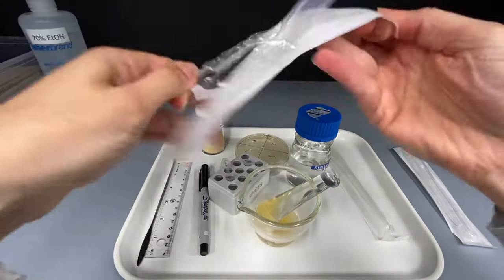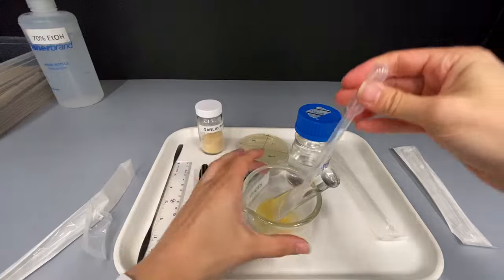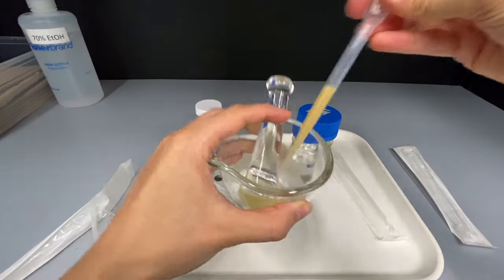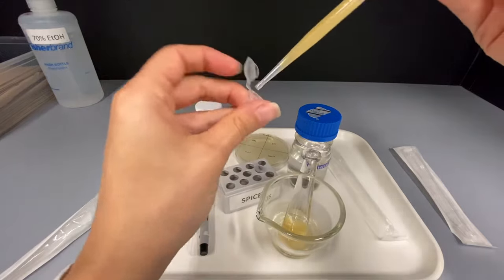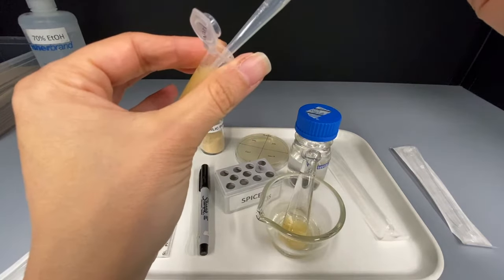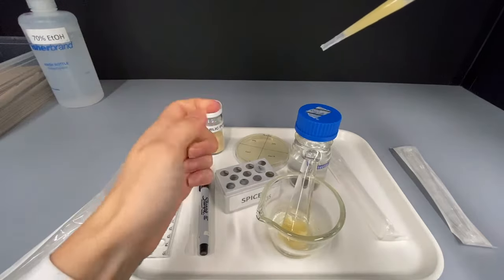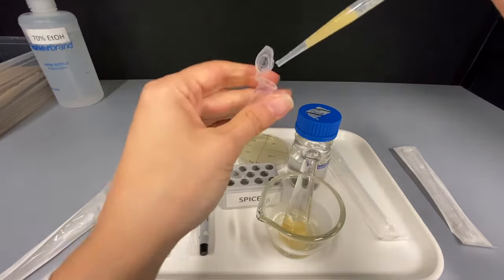Using a clean plastic pipette, transfer 1.5 ml of spice suspension to the tube labelled Gar-1. Take 0.5 ml of spice suspension from the Gar-1 tube and transfer to the Gar-2 tube.